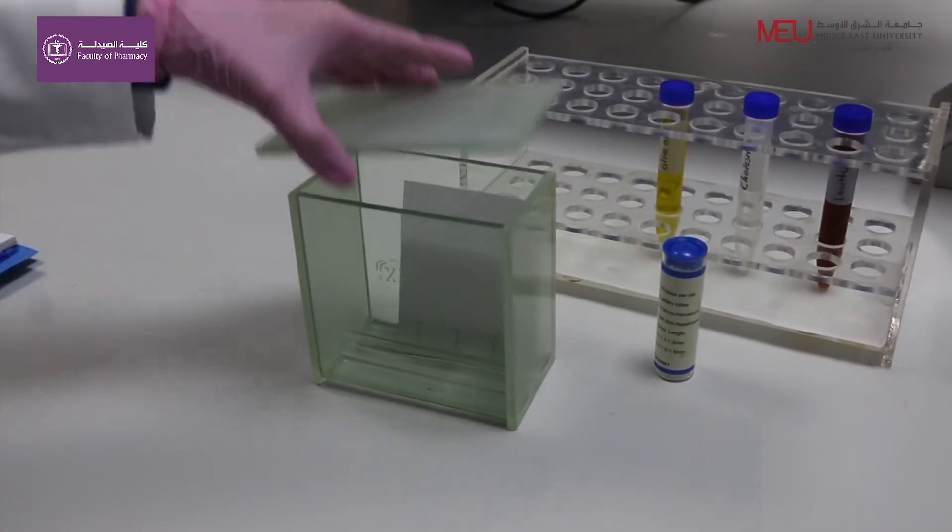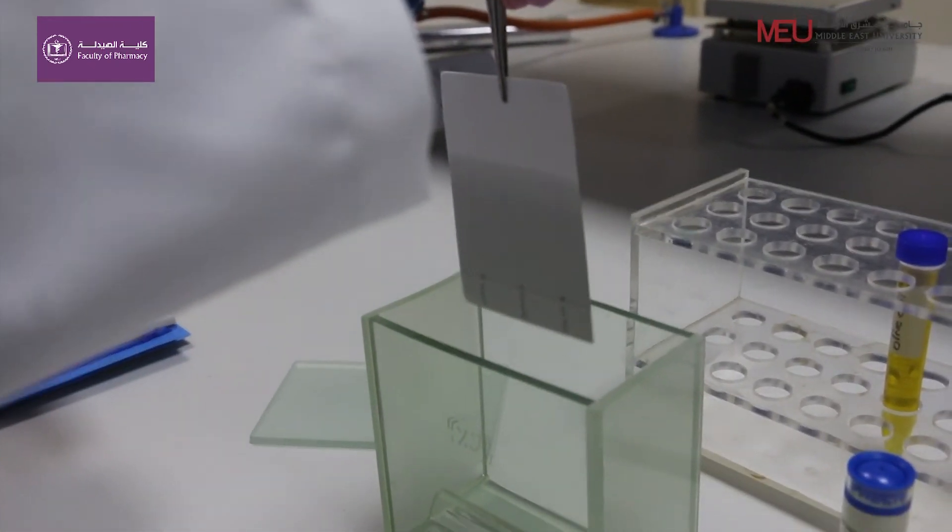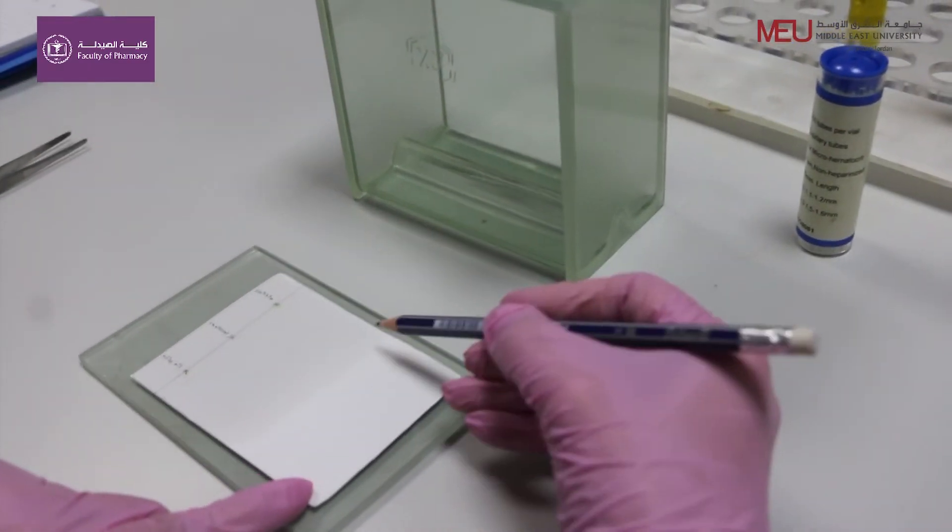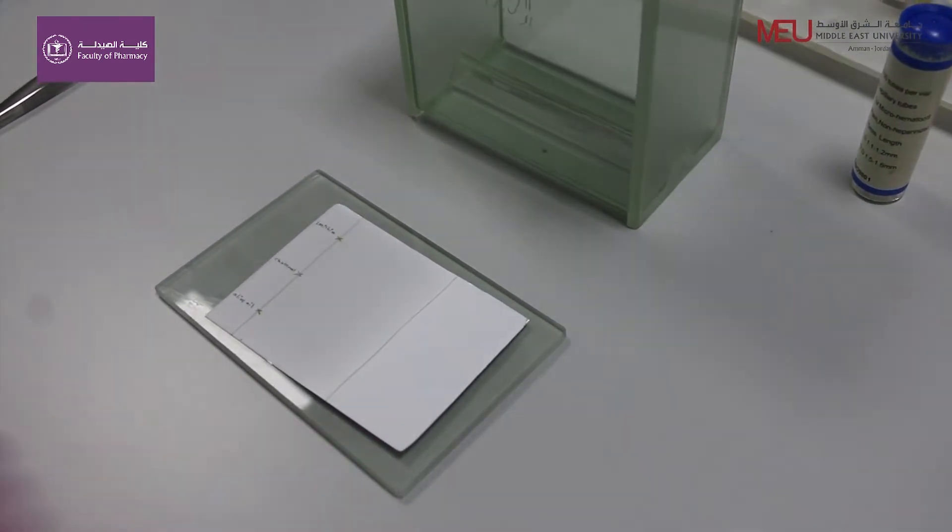Draw a pencil line very gently at the top of the solvent front. Allow the solvent to evaporate from the plate.